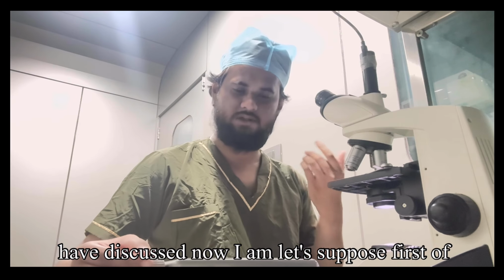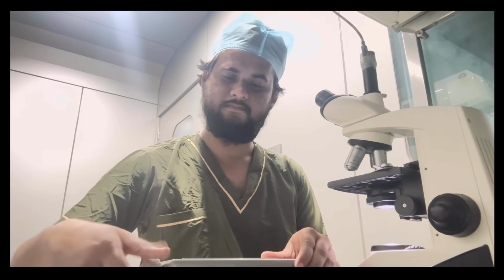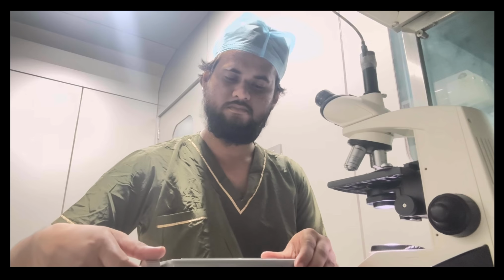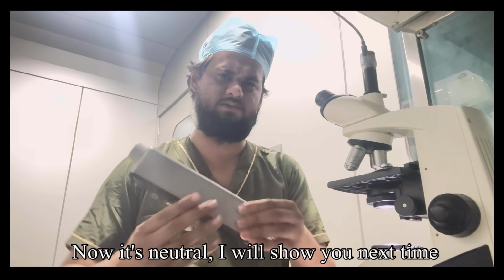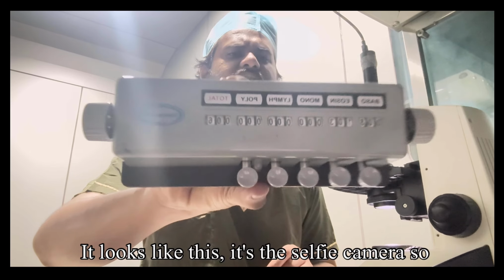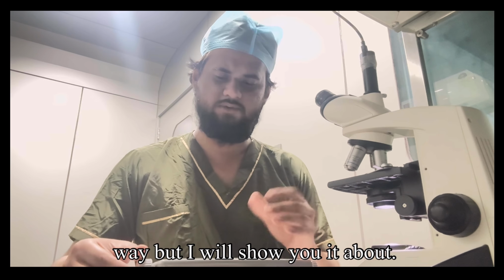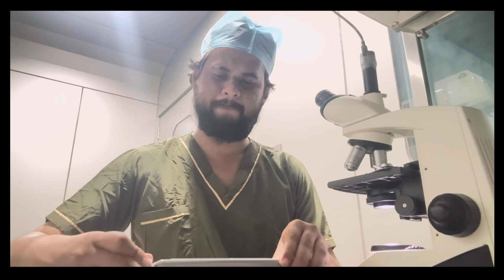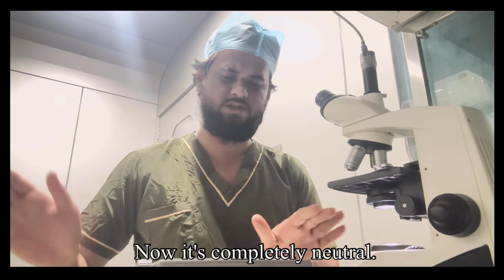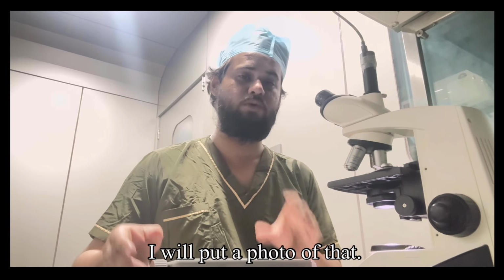Now let's suppose, first of all we will make it neutral. Now it's neutral. It is the selfie camera, so you may not be able to see it in a proper way, but I will show you about it. Now it's completely neutral. How will you know that it's neutral? I will put a photo of that.